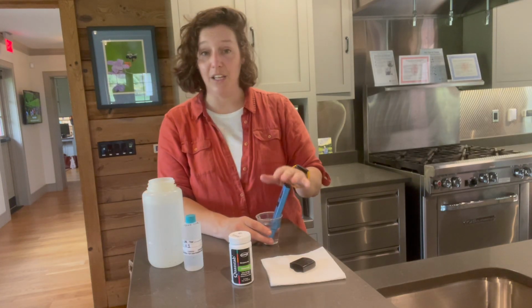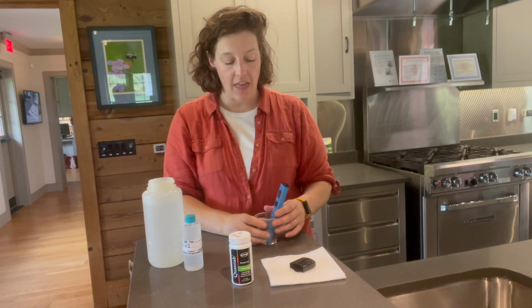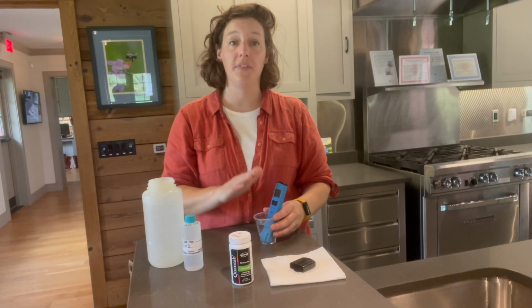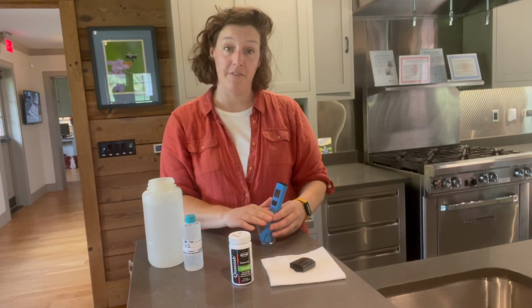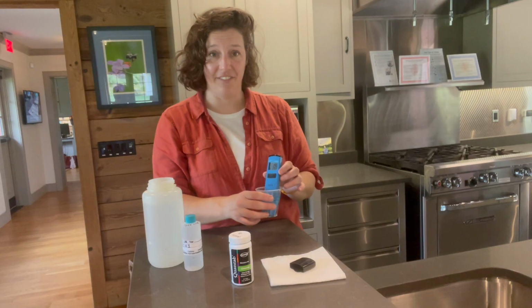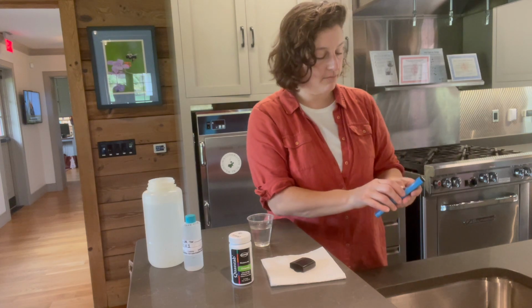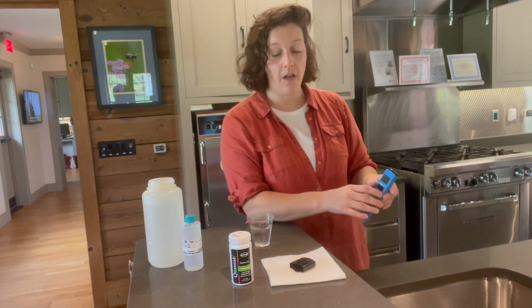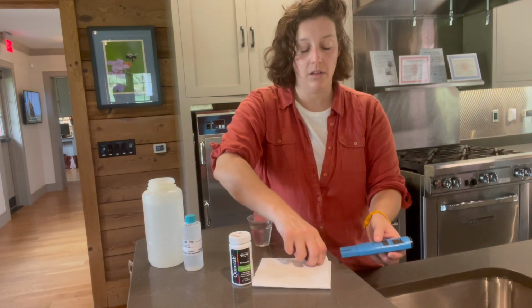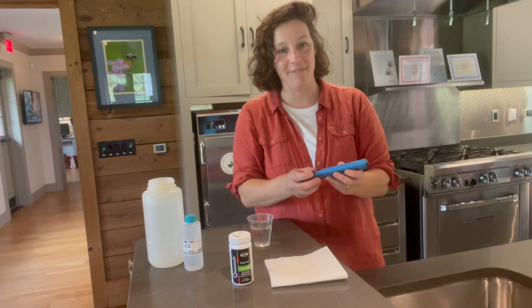So when you take your reading, you'll want to log it on a data sheet that has the site ID, the date, and the time of collection. So now that we have our conductivity reading, it's fast and painless. We can take our meter out of the sample, turn it off, and then we'll rinse it with clean tap water and pat it dry to store it for the next time we're using it.